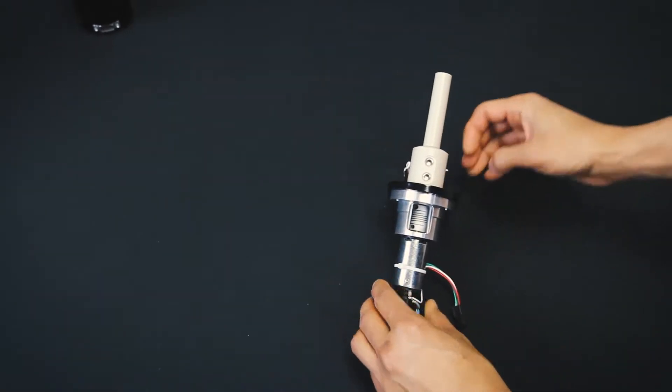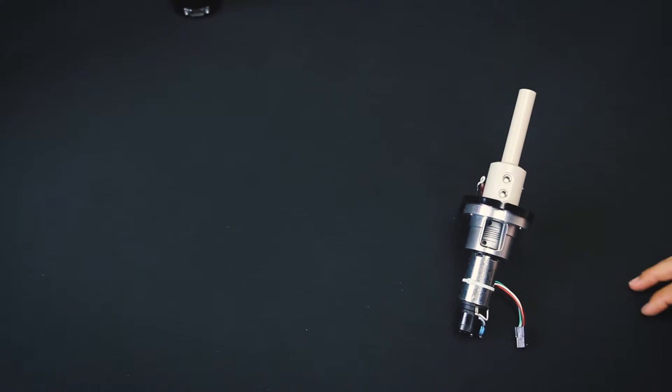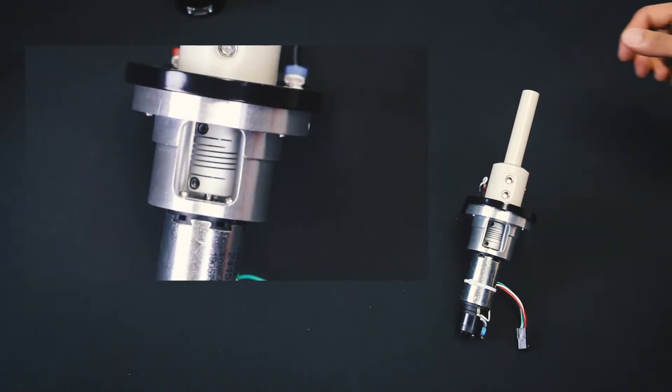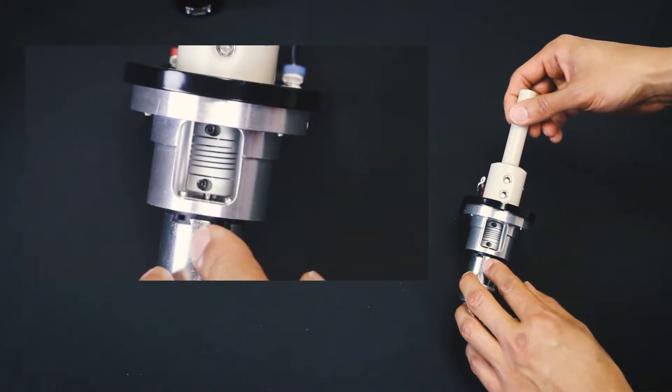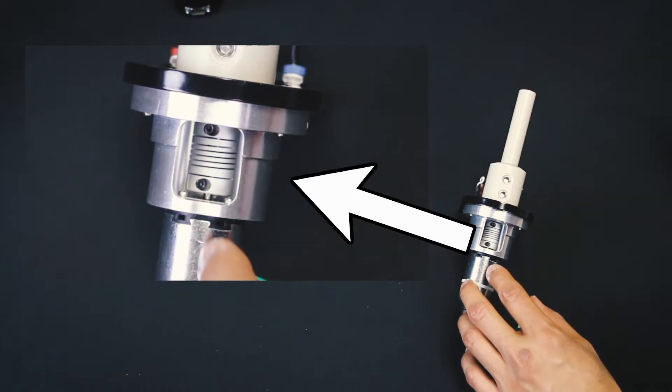Okay, now we have the motor head. If you look here, there is a gap in the motor head where you will see the motor head coupling. The motor head coupling has two hex screws.